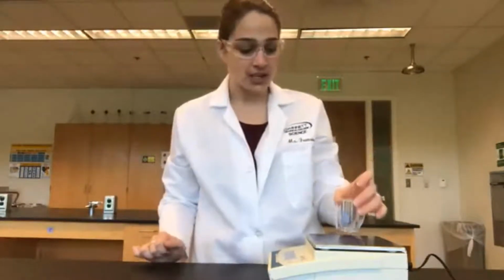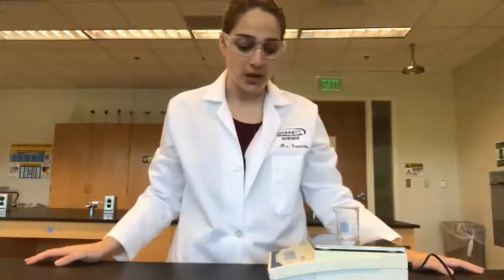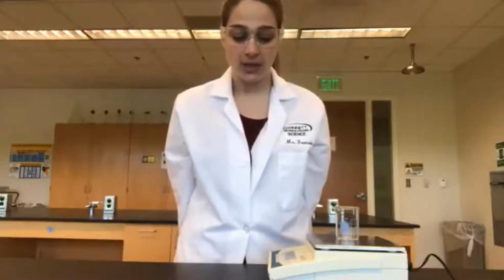And we're going to start by just getting the weight of the beaker by itself. So make sure that you record that the beaker by itself is 30.24 grams. And remember, we always want to give as many digits as are on the instrument itself. So this instrument gives 2 decimal places, so that's what we're going to do, 30.24.